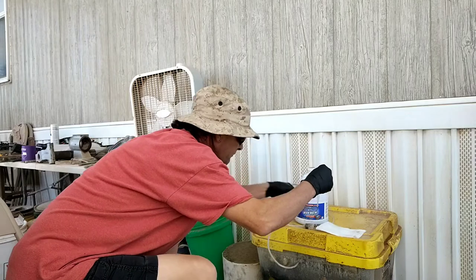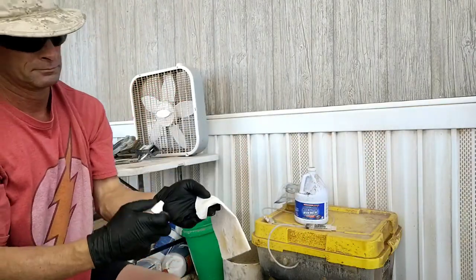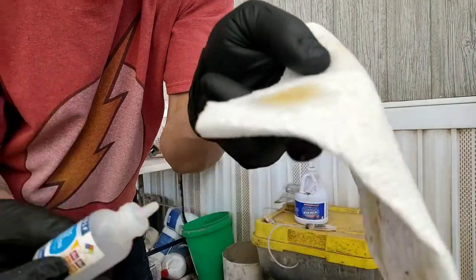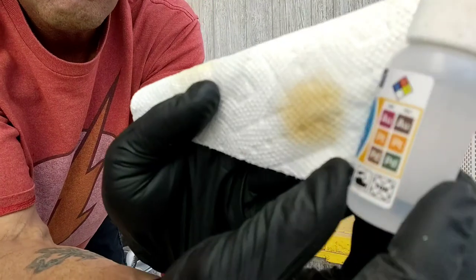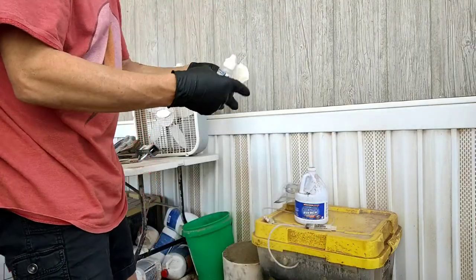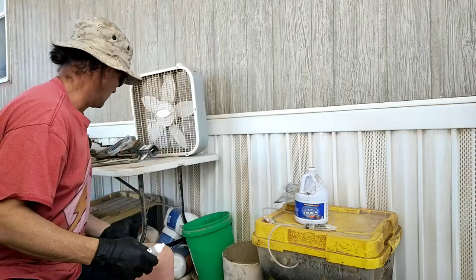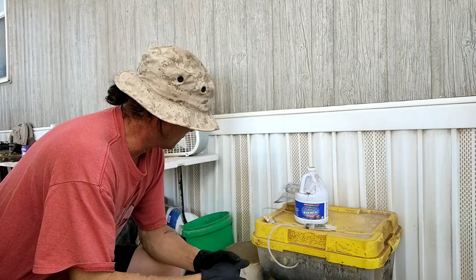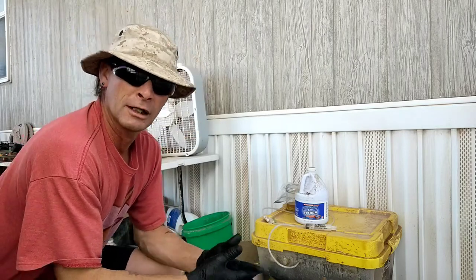Should be all we need right there. A little drop. Wow. That is really, really high in platinum. And that's only been in there since about four o'clock yesterday afternoon. So that is literally less than — that's probably 20 hours that that's been in there. It's probably already completely stripped all the platinum off of that. Wow. That is fascinating. I was kind of hoping it'd turn green. I was really hoping for palladium because it's a little bit more expensive at the time being.